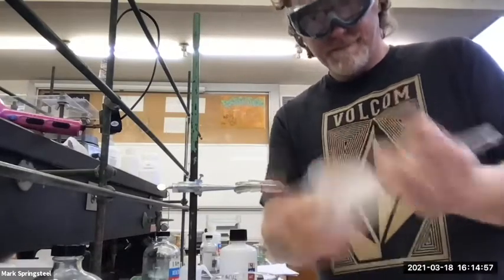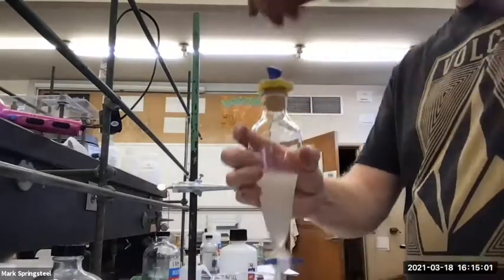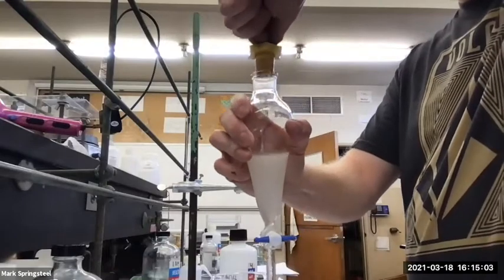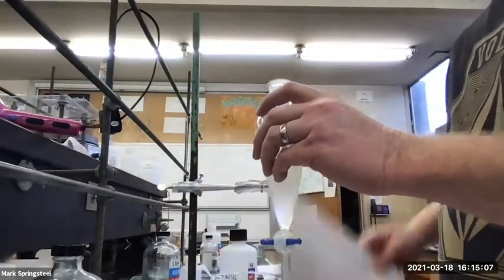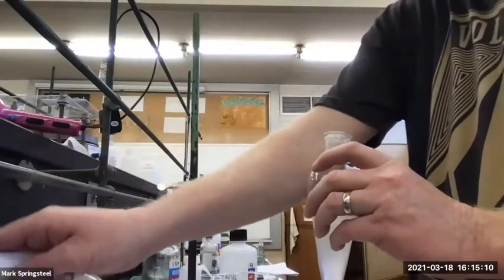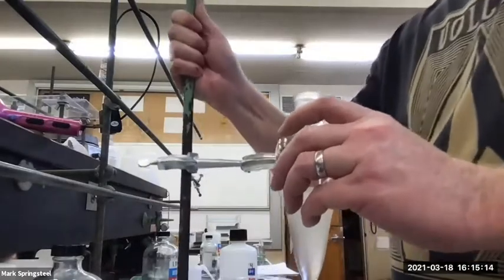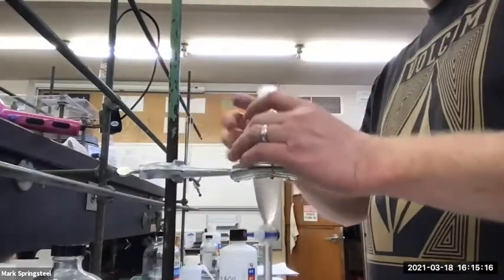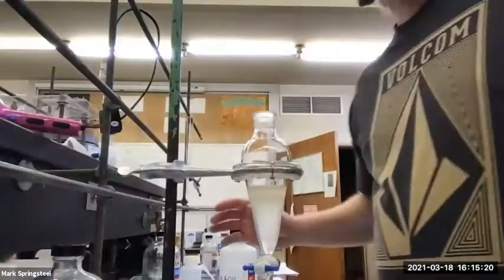So the gas that's venting, what is that? Because the last time you were doing this, you were venting and I could hear it then as well, but we're saying there wasn't the amine in there, so there wasn't that reaction going on. Is there some gas producing reaction? Yeah.